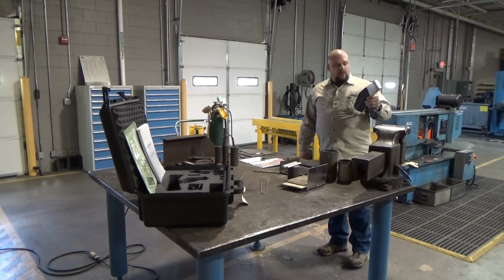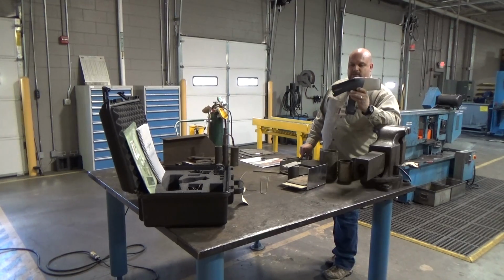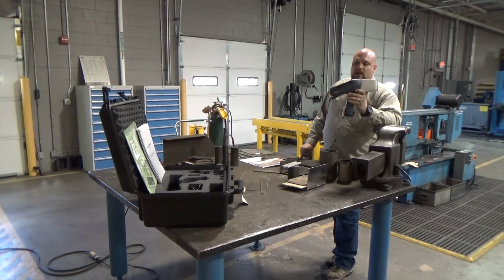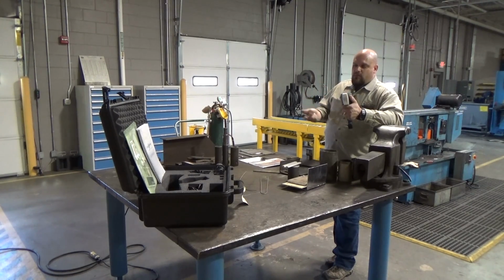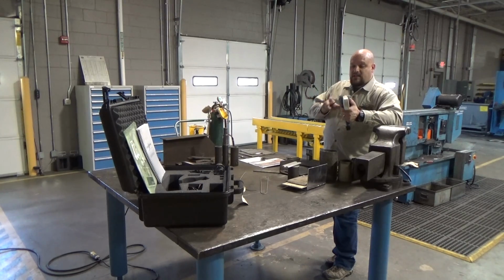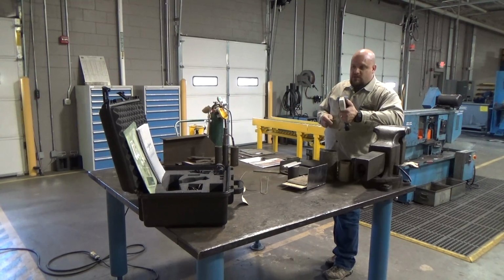Next, I want to introduce you to modern material identification. This piece of equipment I hold in my hand is an alloy analyzer. Now, this machine has the ability basically to take an X-ray, very deep or shallow penetrating, I should say, X-ray, and from that it takes a full chemical analysis. That chemical analysis, it then compares against a database in the machine, and it'll tell you what type of material it is, if it matches one of those particular alloys.